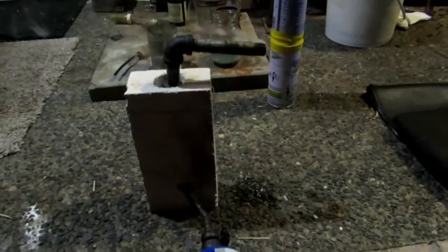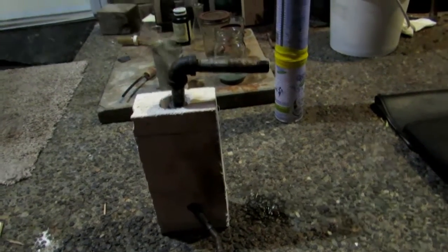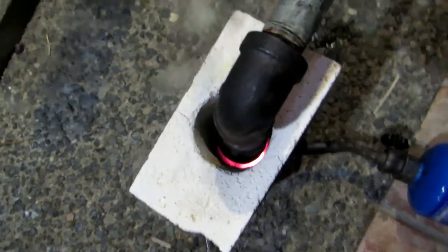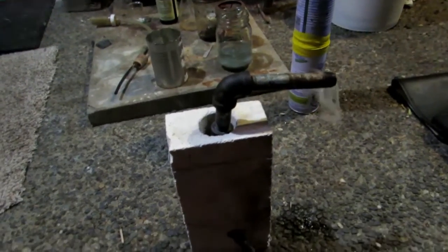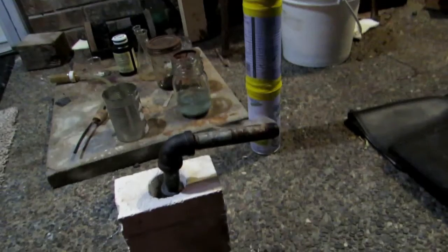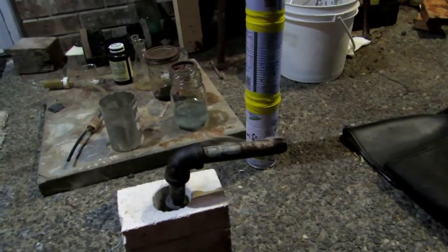As you can see, a copious amount of white fuming is happening, which is a good sign that we're definitely decomposing the chemical. You can see it's glowing red hot down in there. We'll let this run for another 15 minutes or so, definitely waiting until the fuming stops, then do an extra five minutes of decomposition after the fuming has stopped.